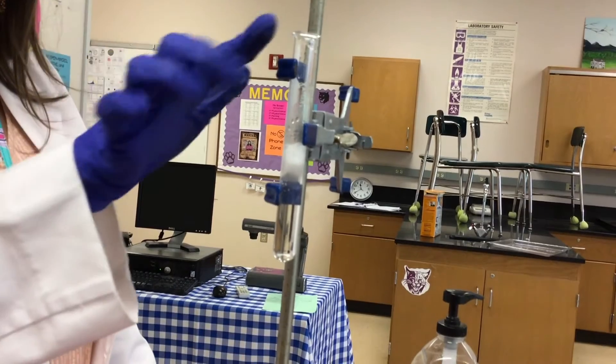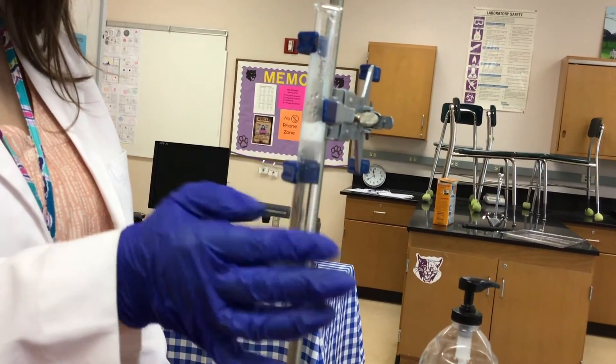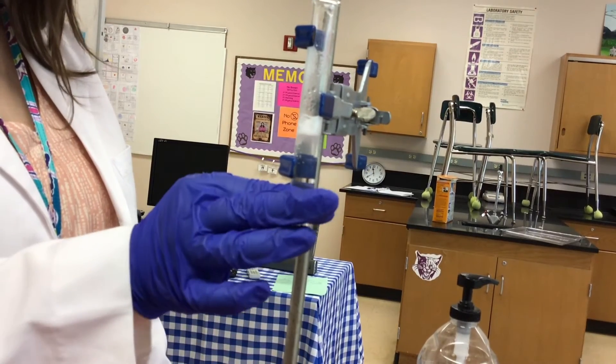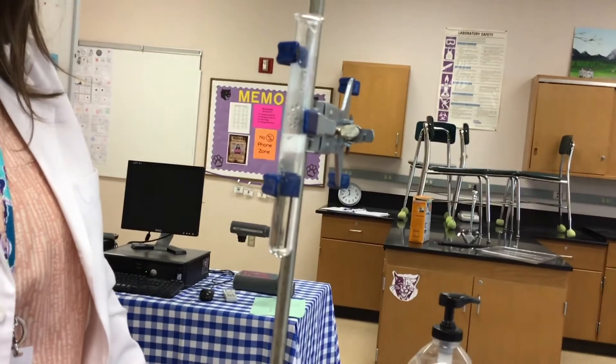Again, you can see the smoke. This reaction is producing heat, and if you were able to touch our test tube, you would feel that our test tube is now hot. There's heat being released by this reaction.